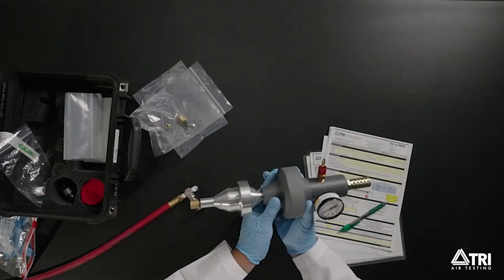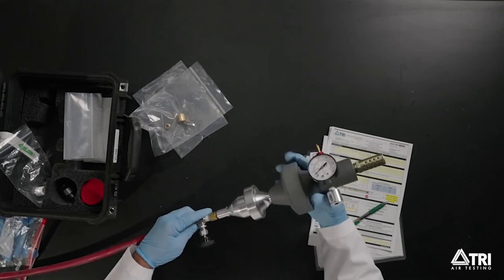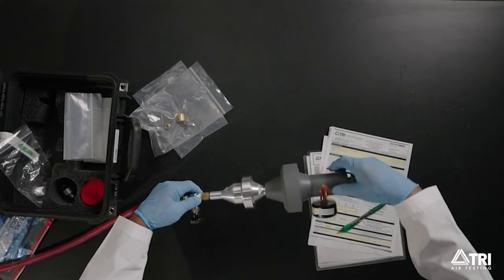Step 4. Immediately connect the completed assembly to your air source. Open the charging lead or air source valve slowly and allow the pressure on the PVC flow section gauge to stabilize.